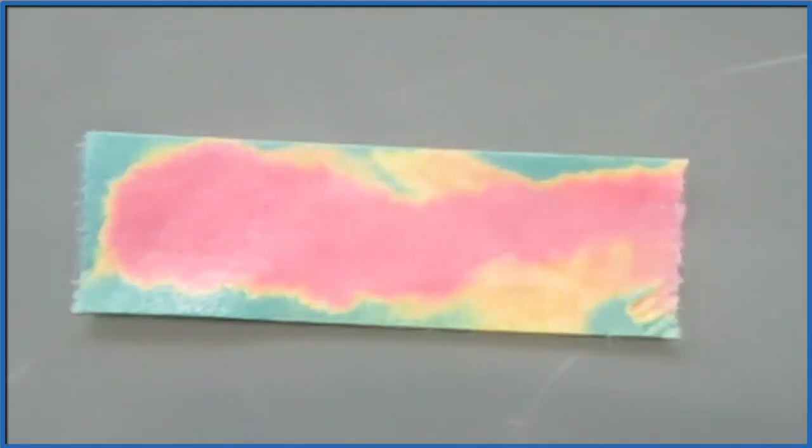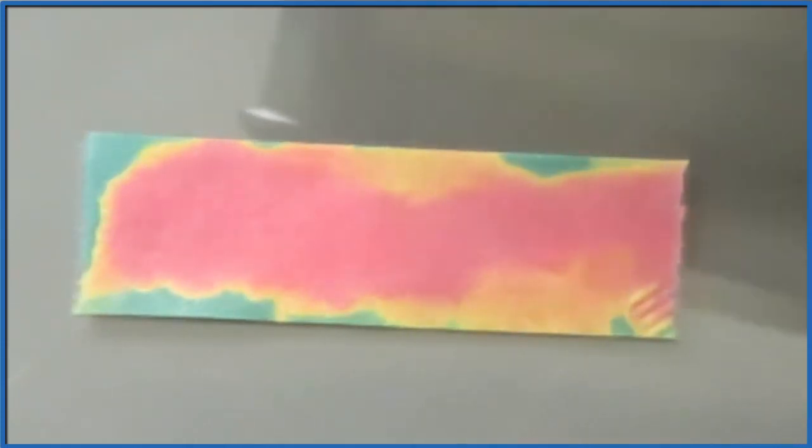And in between you can see the acid, the hydrochloric acid, and the ammonia base. They're neutralizing each other and we have that more neutral yellow color. We add more ammonia and wait, eventually it'll neutralize all that hydrochloric acid and the paper will turn green.